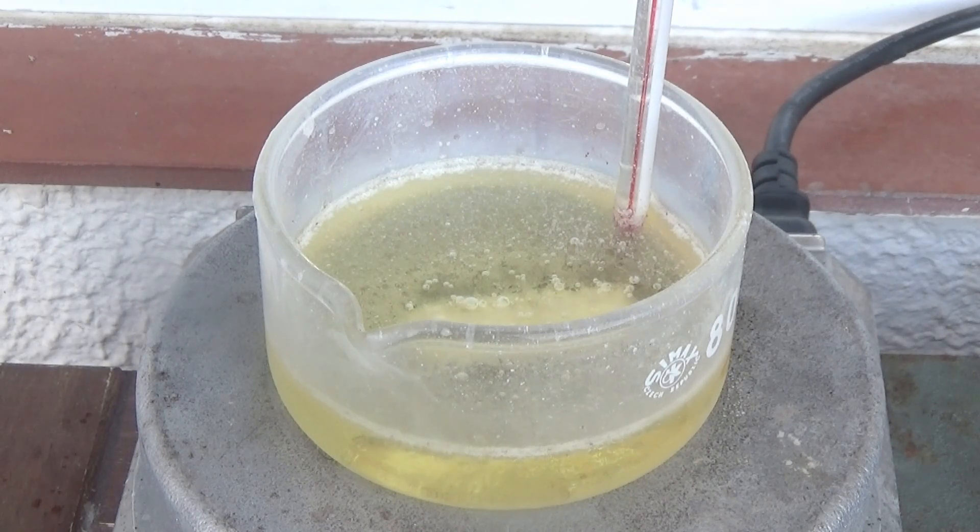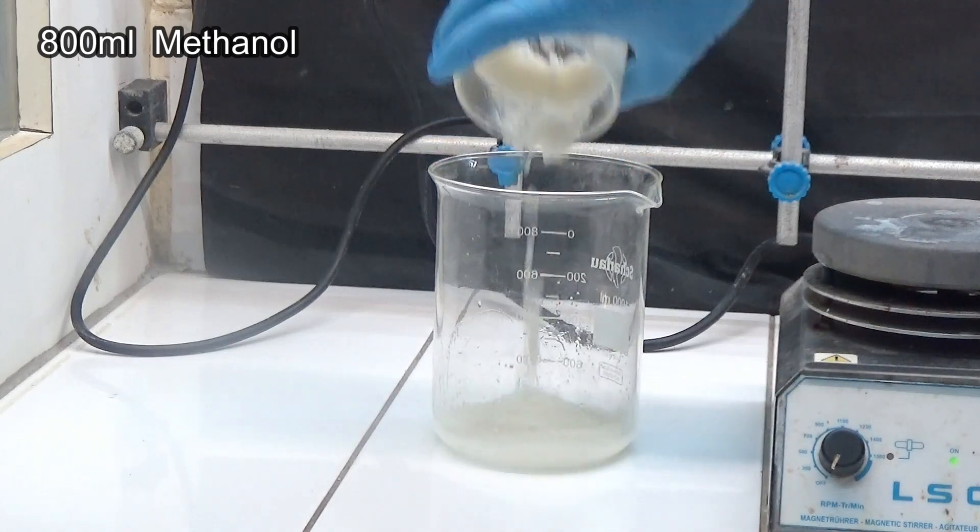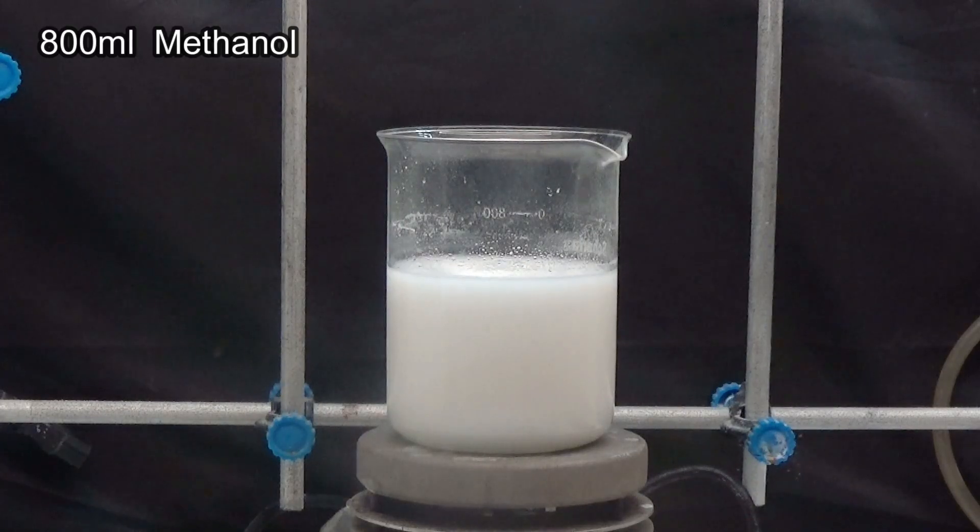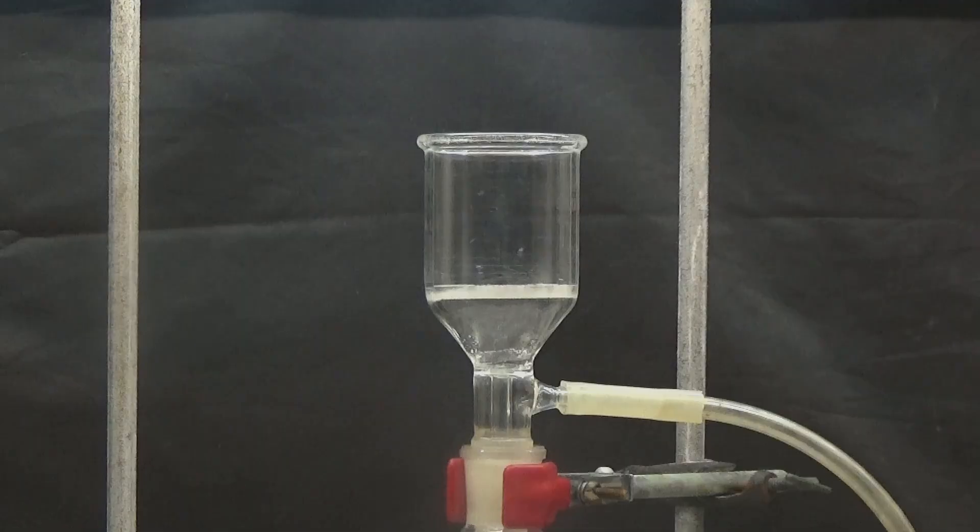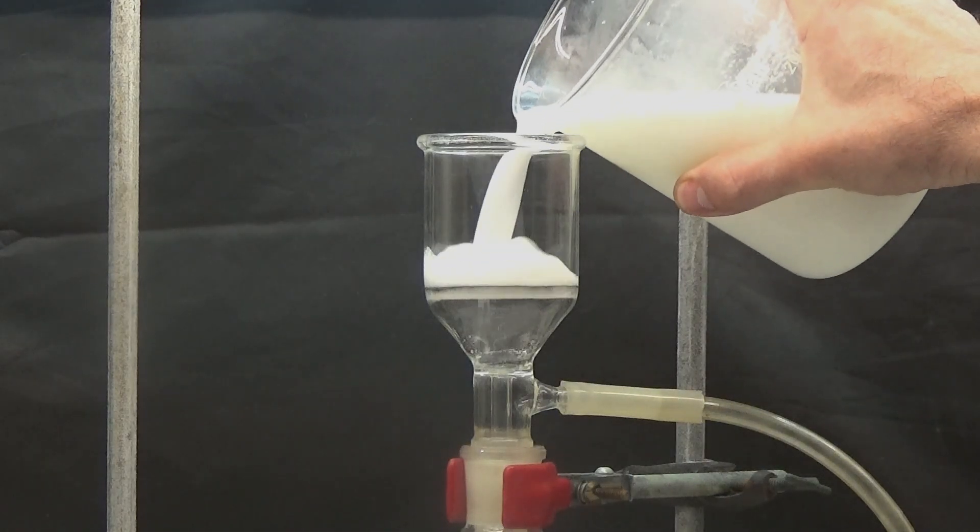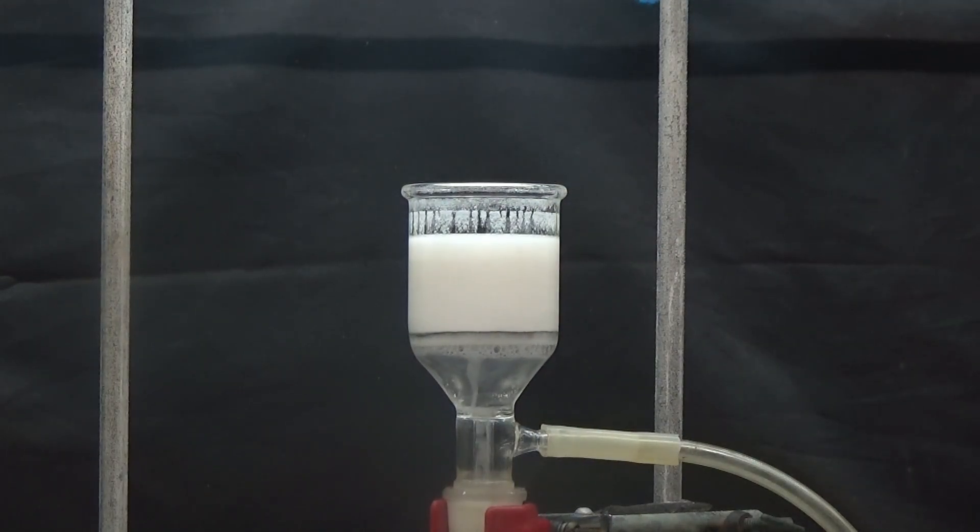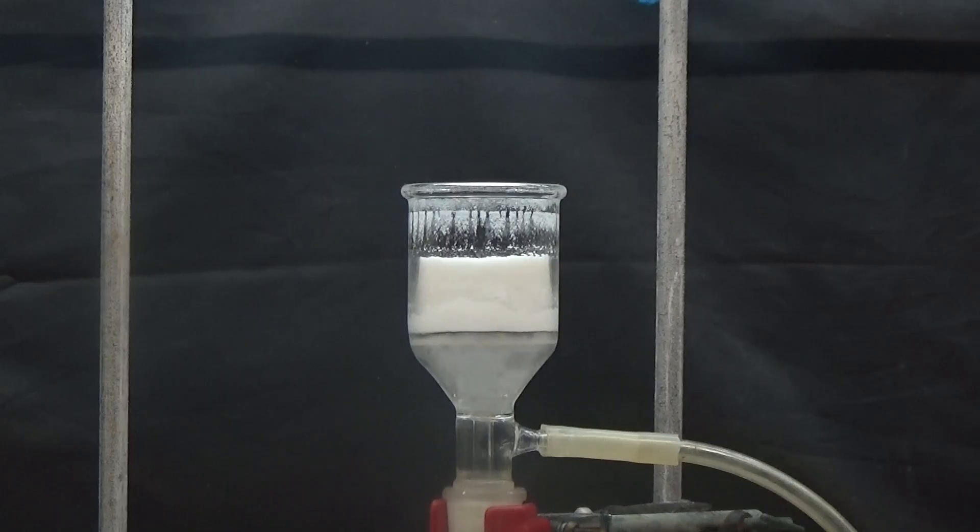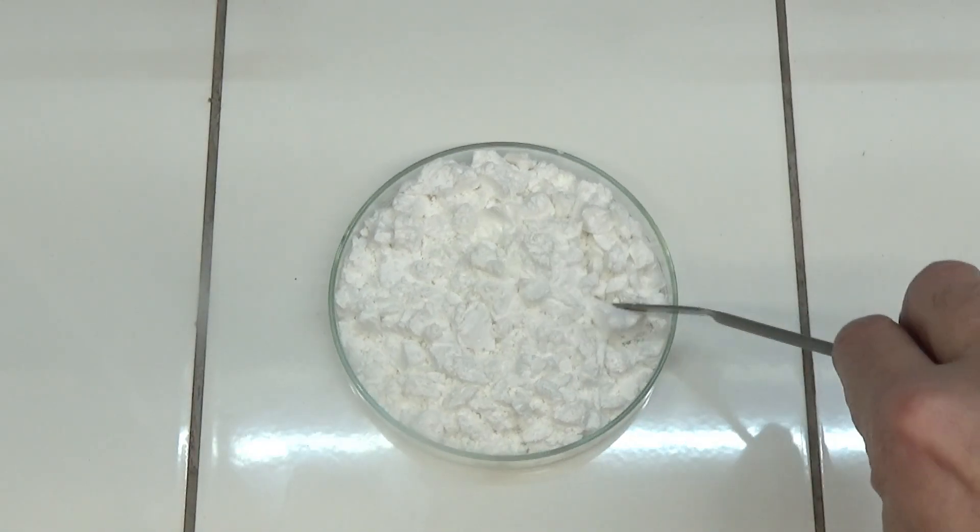Let cool and disperse the solid in 800 milliliters of methanol. Store in refrigerator for 12 hours. Collect the solid obtained by suction and wash with a little methanol. We dry the solid at 60 degrees and determine the purity with the melting point.